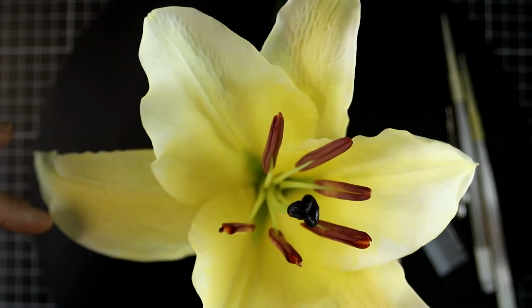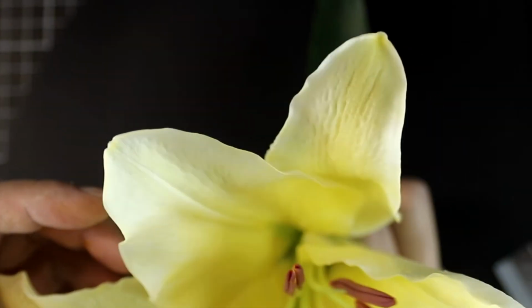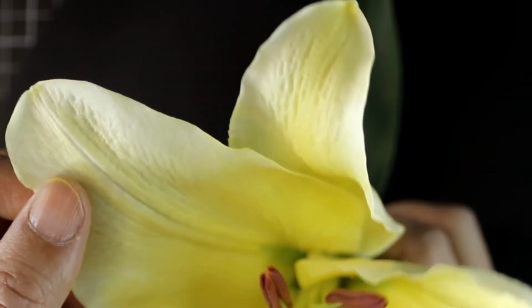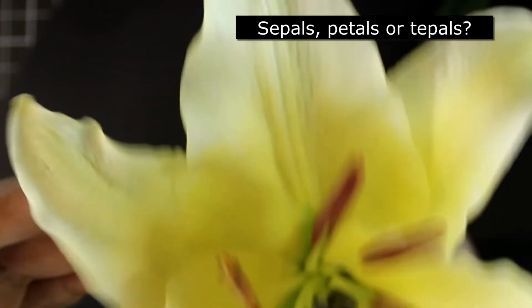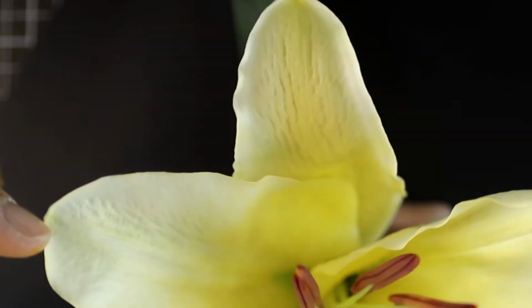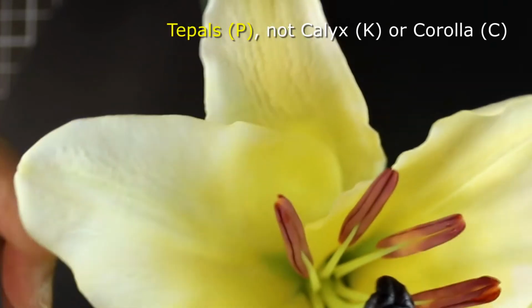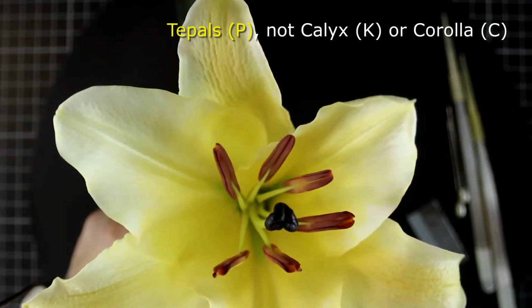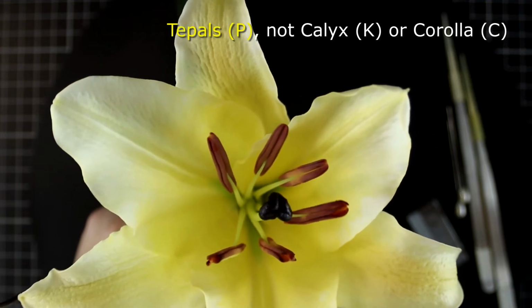Do they look similar? Probably yes. So how would you call them? Sepal, petal, or tepal? As morphologically they look very similar, we'll regard them as tepal. So for your floral formula, please use P instead of K and C.